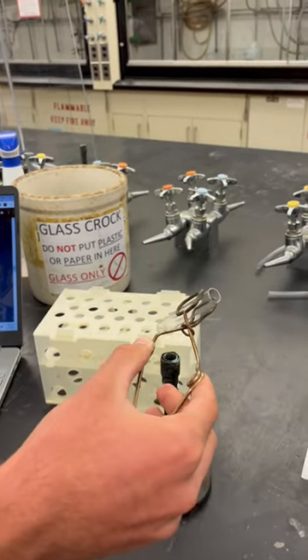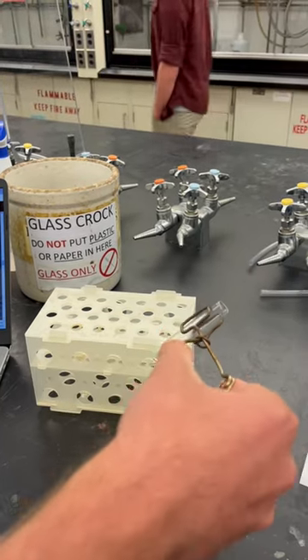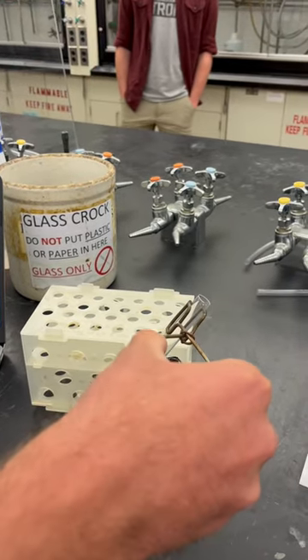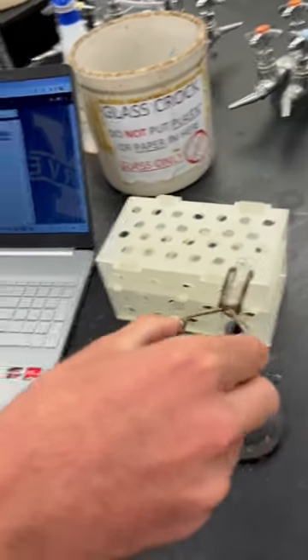So what we do, we kind of put the test tube over the flame, so that it can warm a little bit more than one spot. We can kind of gently rotate it, but the goal is to keep the opening of the tube away from the people, so that nothing shoots out.